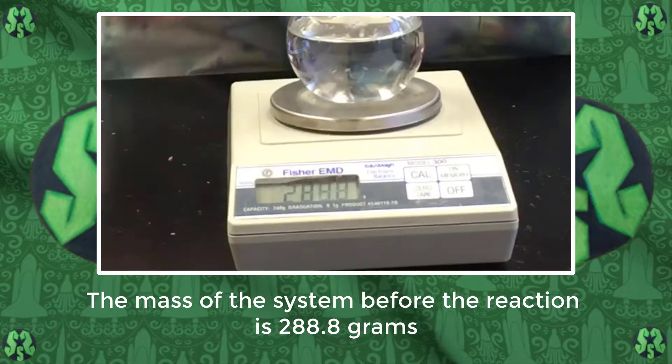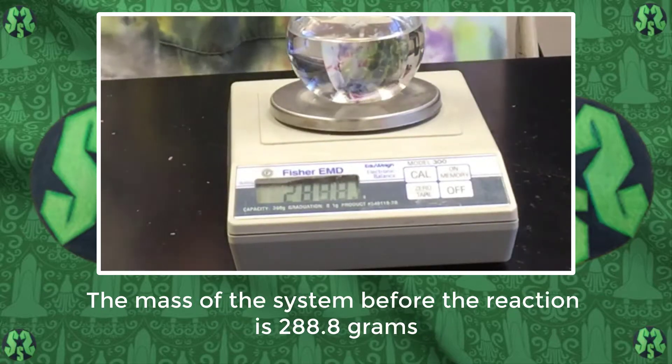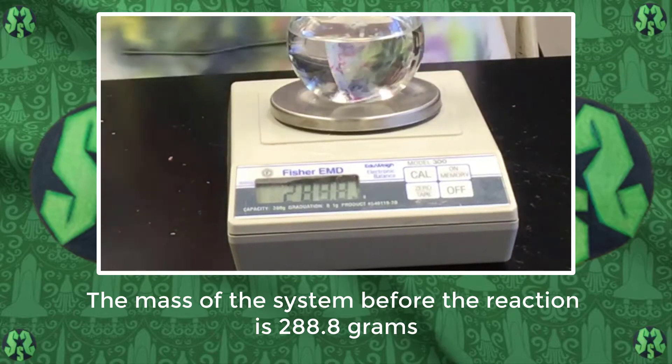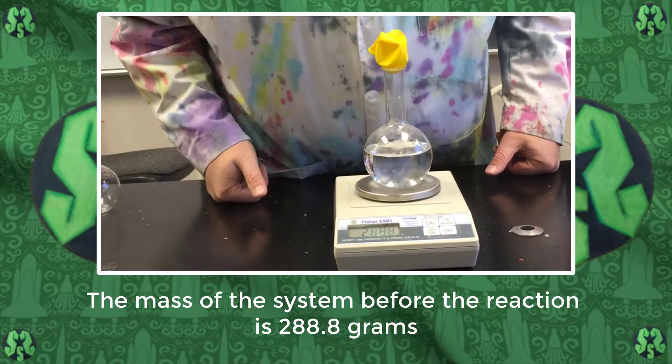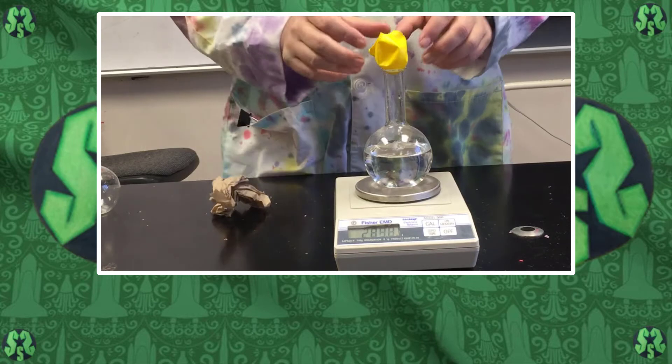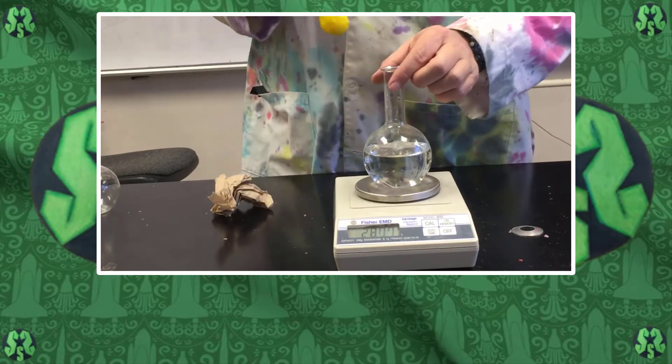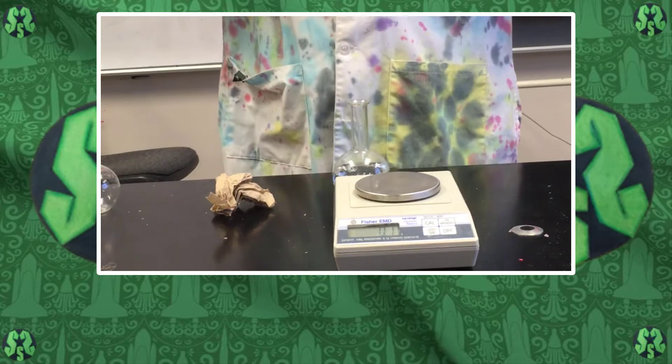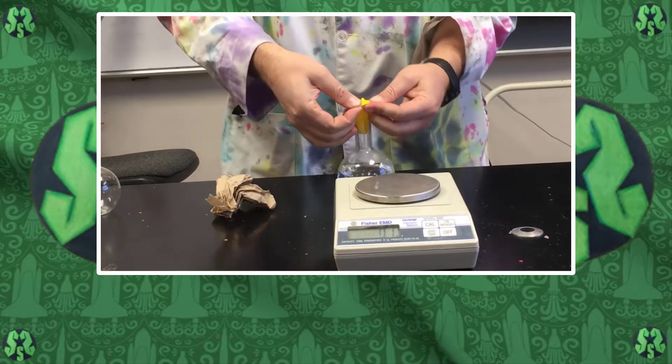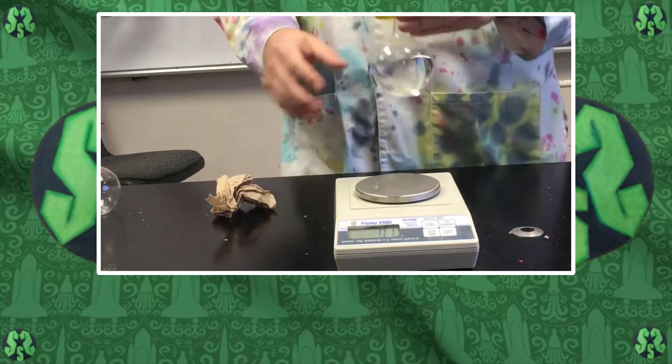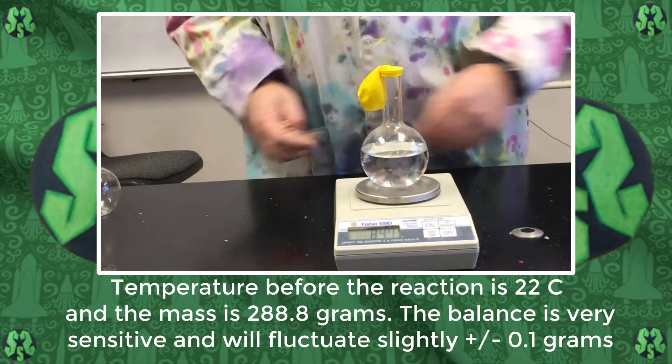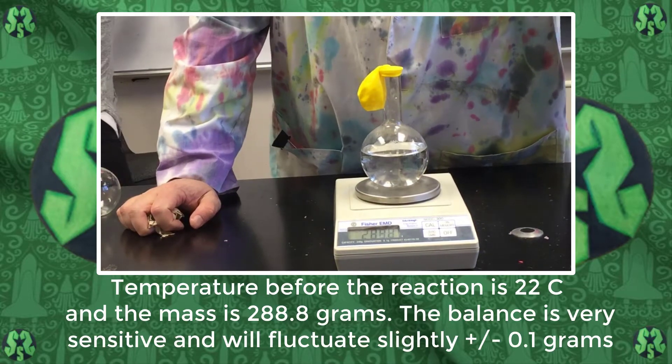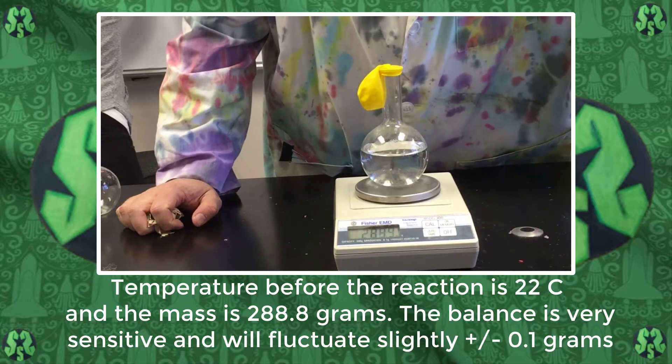Now we need to measure the mass. Okay, 288.8 grams. Now we need to do the reaction. Let's make sure we're still at 288.8 - that's 288.9 grams.